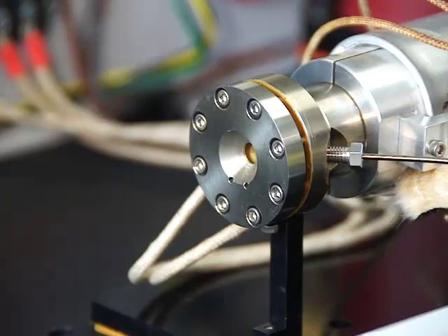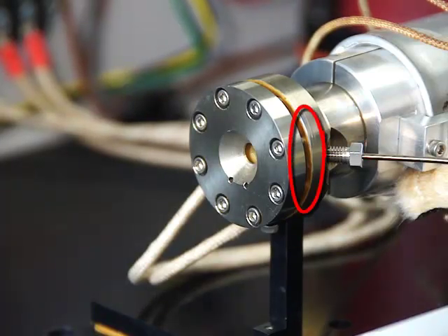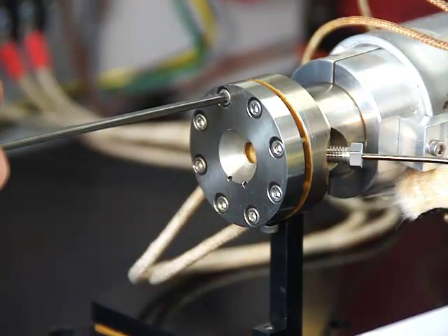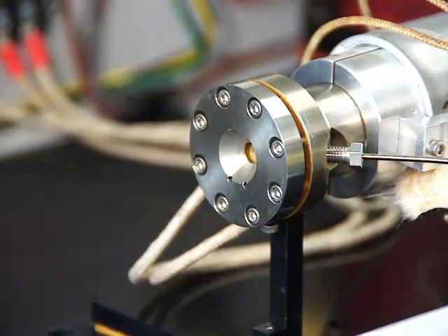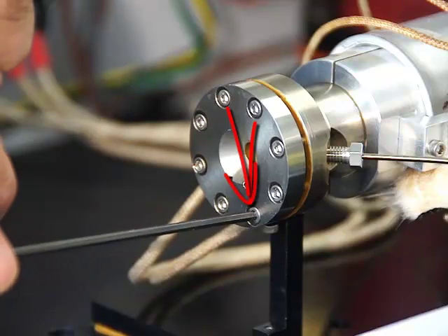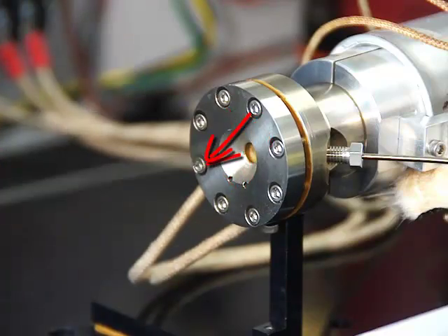Inspect the position of the end cap to make sure it is parallel to the light pipe's end surface and the window remains centered. In a star pattern, tighten only until slight resistance is felt.